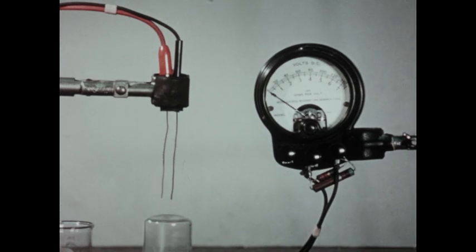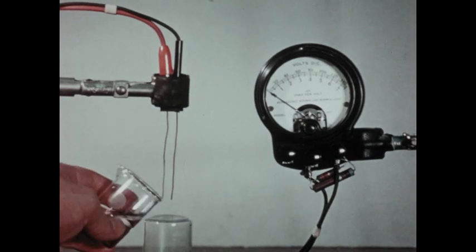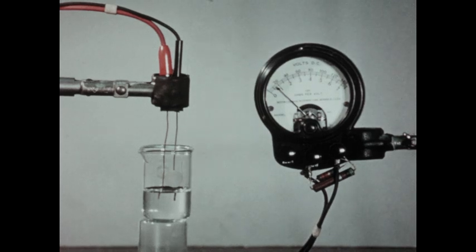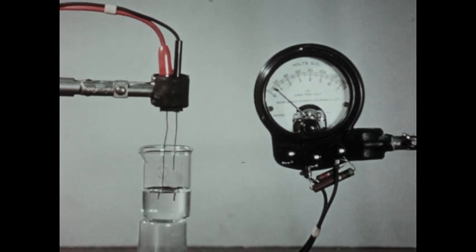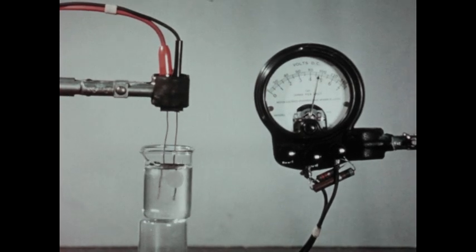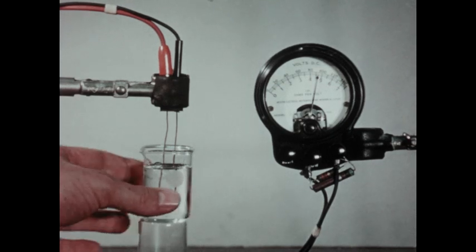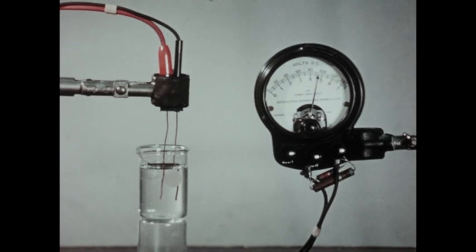The conductivity of a solution depends not only on the solute but on the solvent as well. In this small beaker, we've placed a few milliliters of a solution of phosphoric acid in alcohol, and you'll notice that the solution conducts the current to a small degree. Now, to this alcohol solution of phosphoric acid, we'll add a few milliliters of distilled water, which is itself, as we saw earlier, a non-conductor. You'll observe that the addition of the non-conducting distilled water to the solution of phosphoric acid in alcohol has resulted in a mixture which conducts the current very well. In fact, the original conductivity of this solution was probably due to traces of moisture which dissolved in the alcohol from the air in the room.